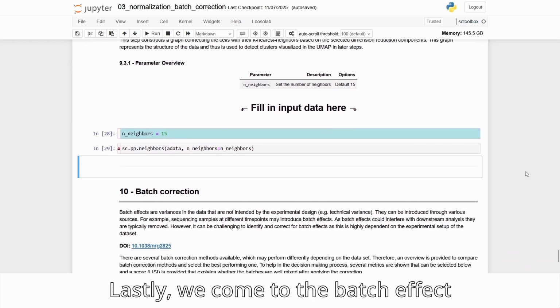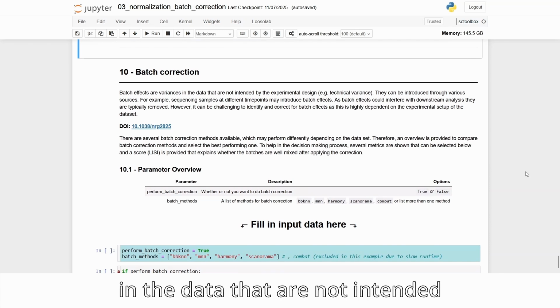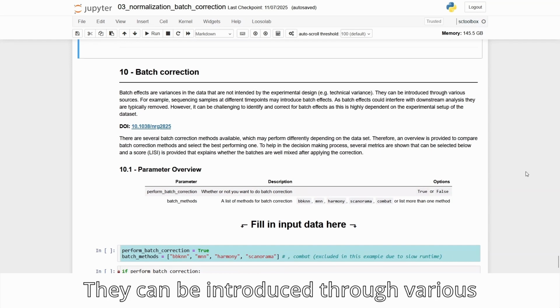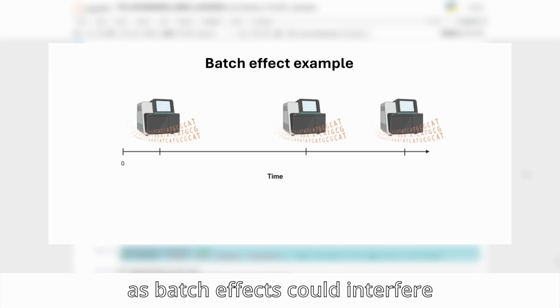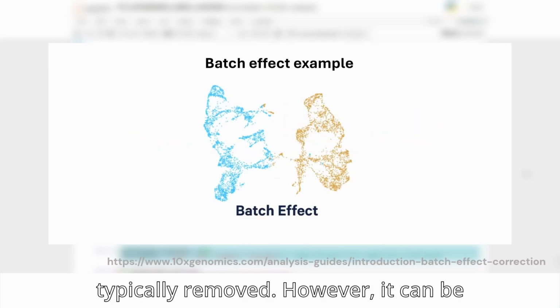Lastly, we come to the batch effect correction. Batch effects are variances in the data that are not intended by the experimental design, for example, technical variances. They can be introduced through various sources. For example, sequencing samples at different time points may introduce batch effects. As batch effects could interfere with downstream analysis, they are typically removed.